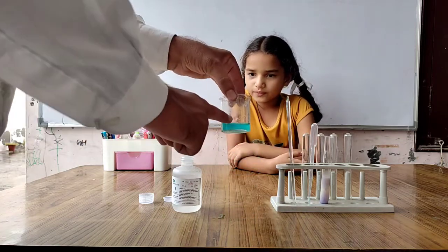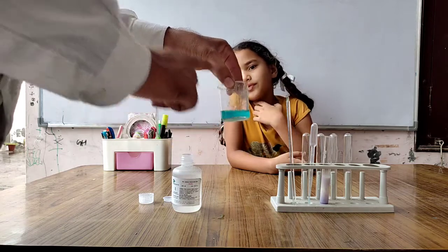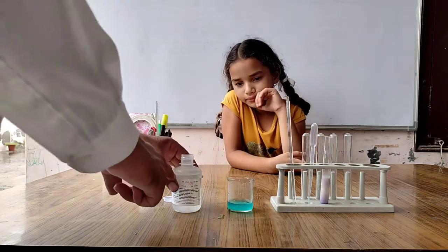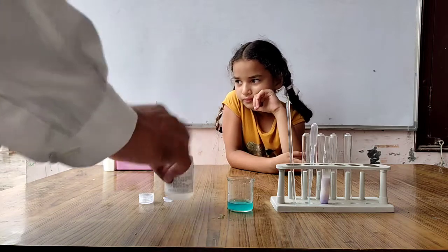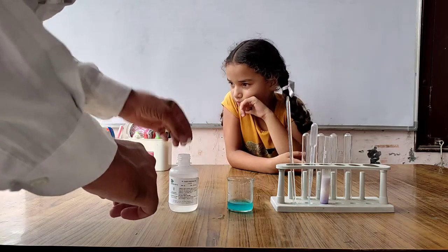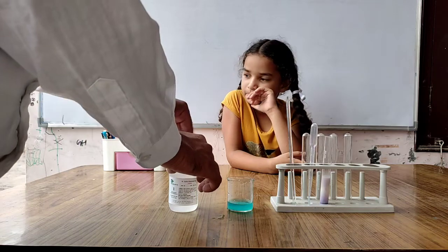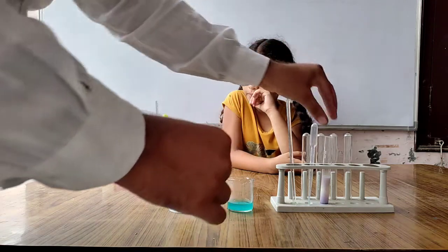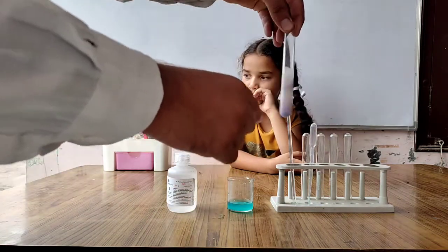We took milk in a test tube, whose color is white as we already know. Then we added two drops of copper sulfate, and ten drops of sodium hydroxide. The color of milk changed into purple.